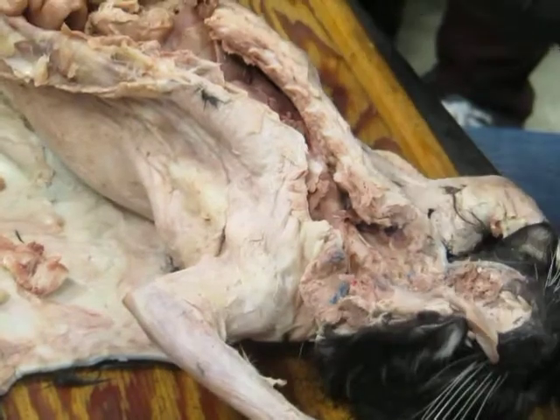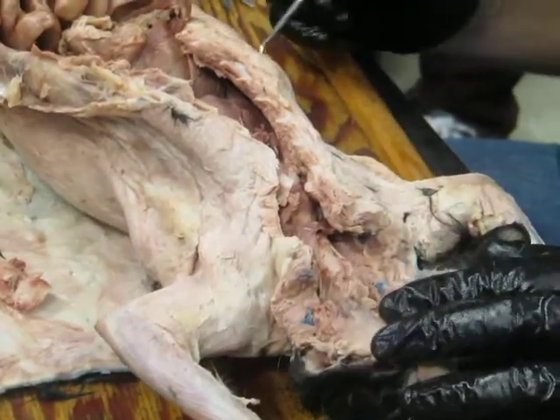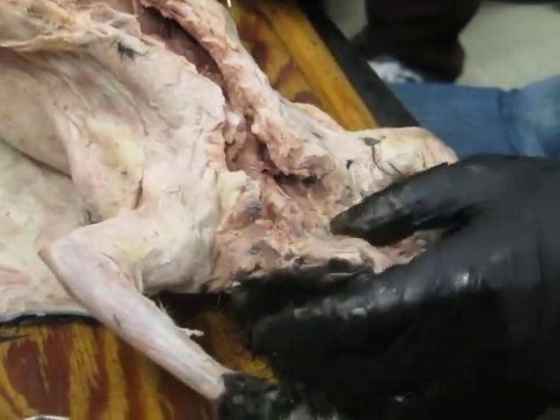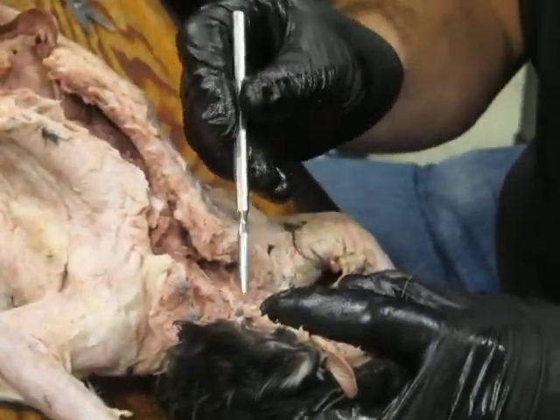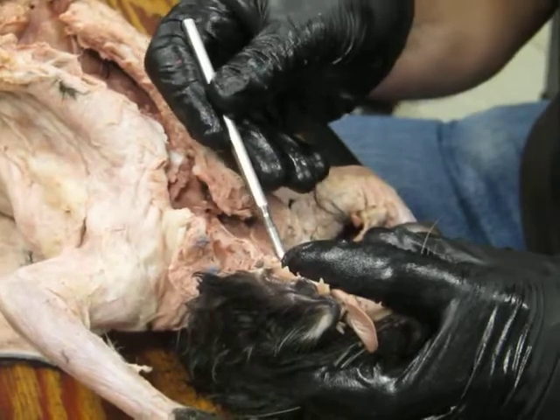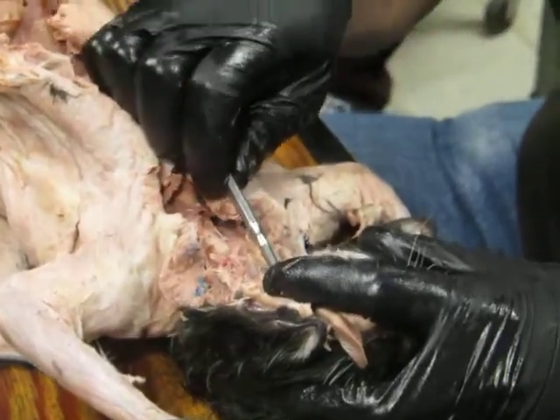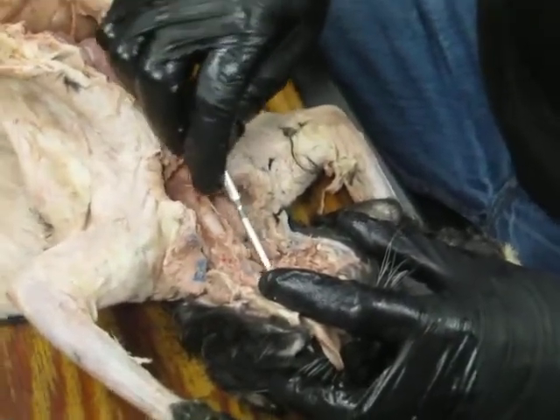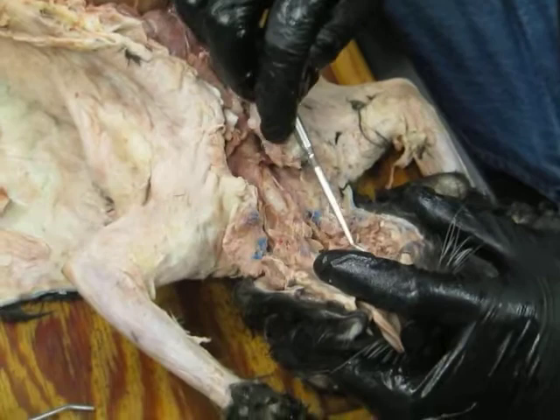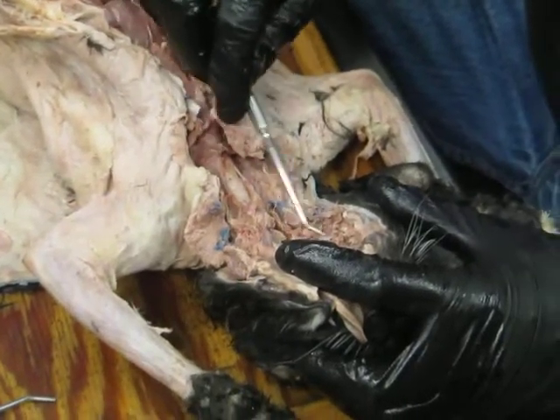Okay. What would be the choanae then on this? That's just a part of it. The choanae are, technically speaking, the opening of the nasal cavity into the nasopharynx, which is back up in here. And what you can't see here is that the nasopharynx, where I've got the probe, goes all the way across the midline. It's just one chamber.